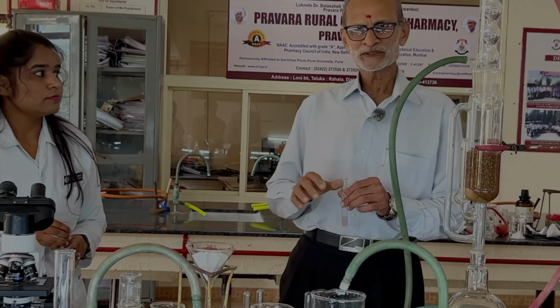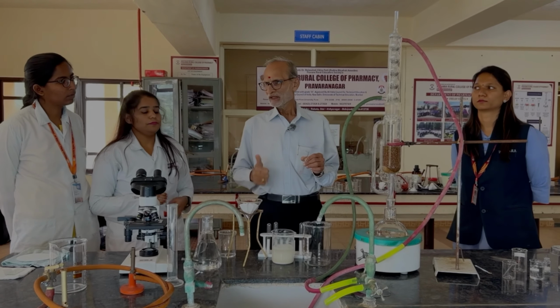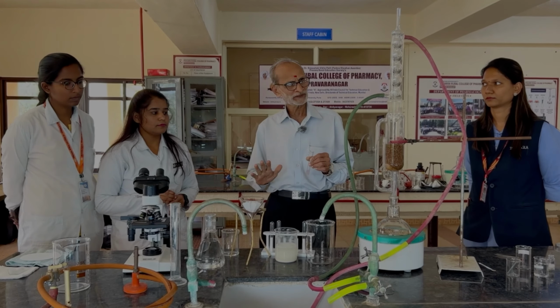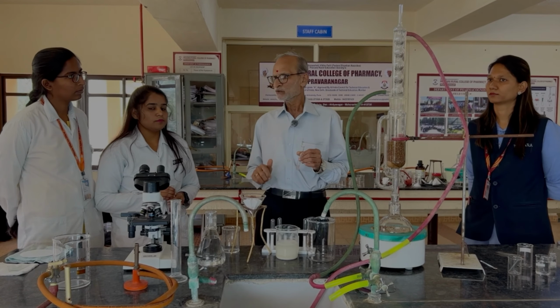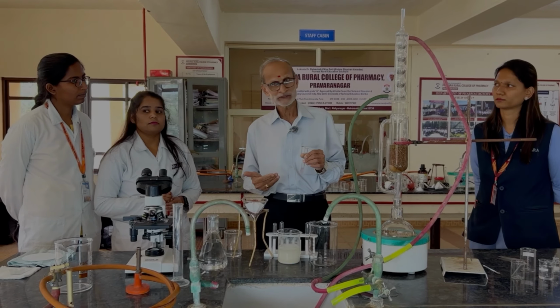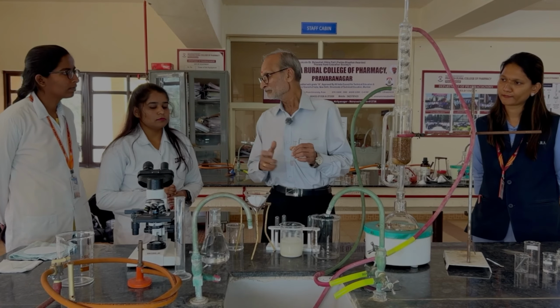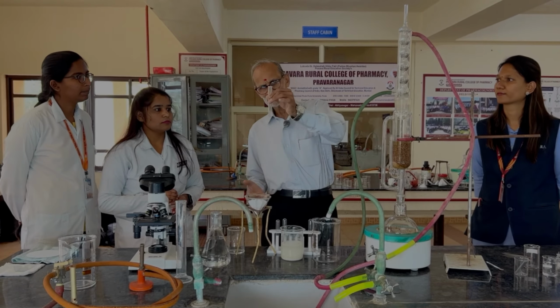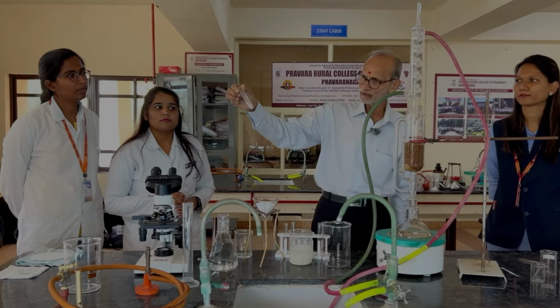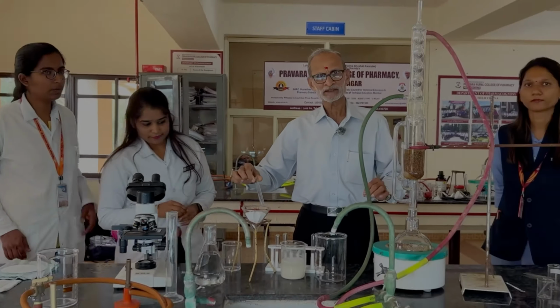Why it has become purple, I'll tell you. Starch comprises two components, amylose and amylopectin. Amylose is a linear polymer, amylopectin is a branched chain. Amylose gives an intense blue color and amylopectin gives a pink color with iodine. And together what you get is a purple color. So you can see here the purple color got developed. Are you able to capture the purple color?